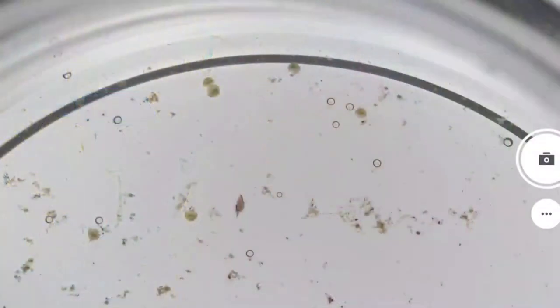Today I decided to go back to this microscope, the stereo microscope, and to show you something else from my pond once again. And this time it's a funny little creature called a seed shrimp, otherwise known as an ostracod. So ostracod, like ostracod and cod, like the big fish. No idea why.